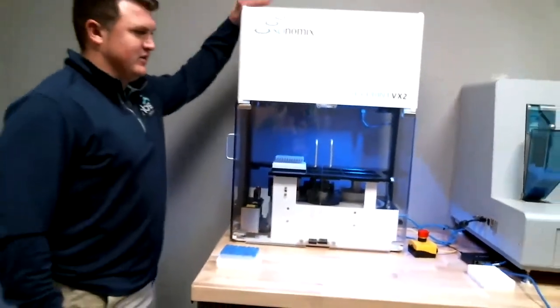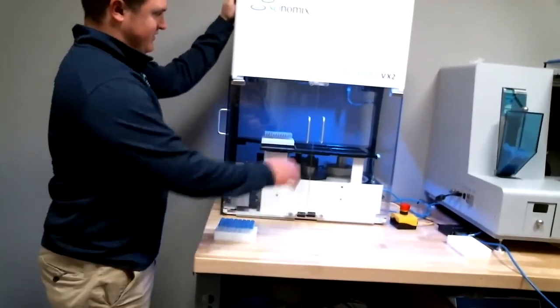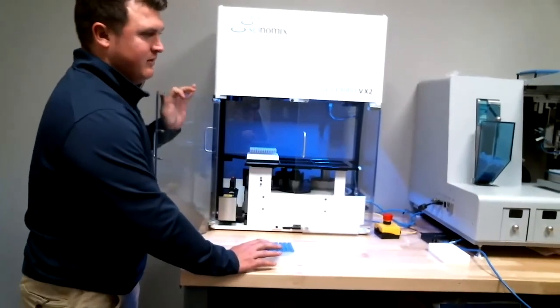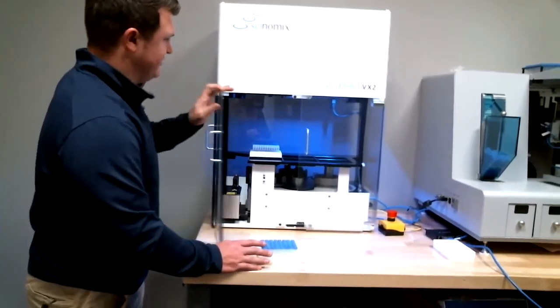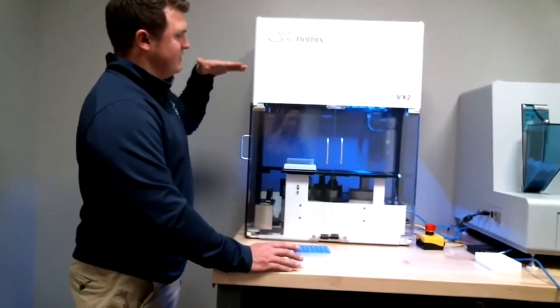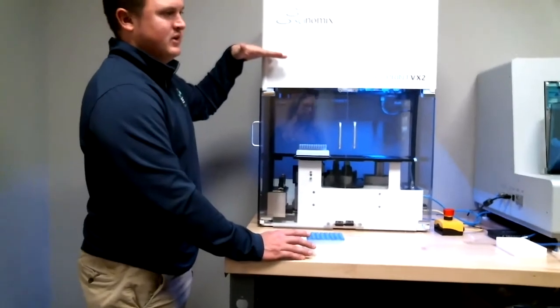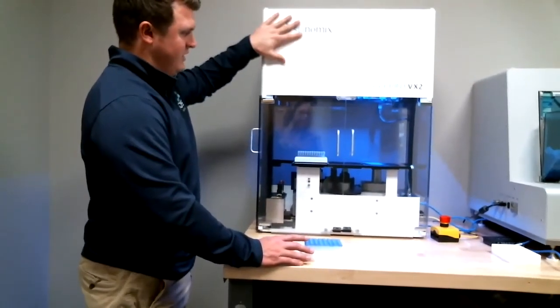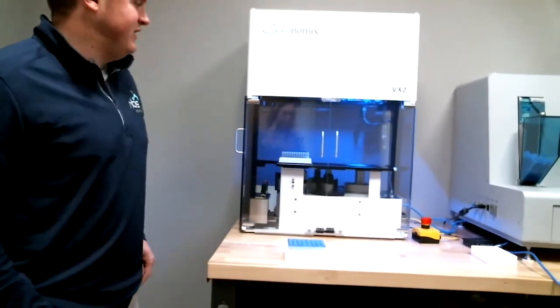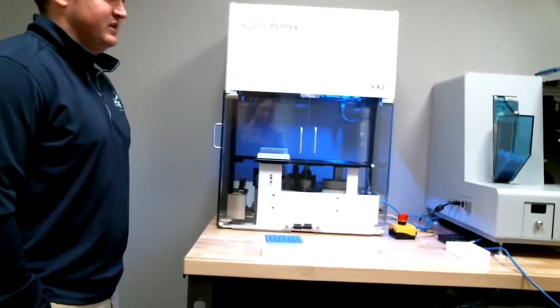So as you can see, this is the size of the unit here. It fits perfectly on a lab bench. And the doors only come out a little bit, so it's not like you're going to be walking into them every time if it's towards the edge of the bench. But the HEPA filter does sit on the back of the unit. Now the short unit is basically the same unit here, but the top is lowered, so the upper gantry, the gripper head is lower, so that it does have the option to fit into a hood if you have a hood large enough to fit it.